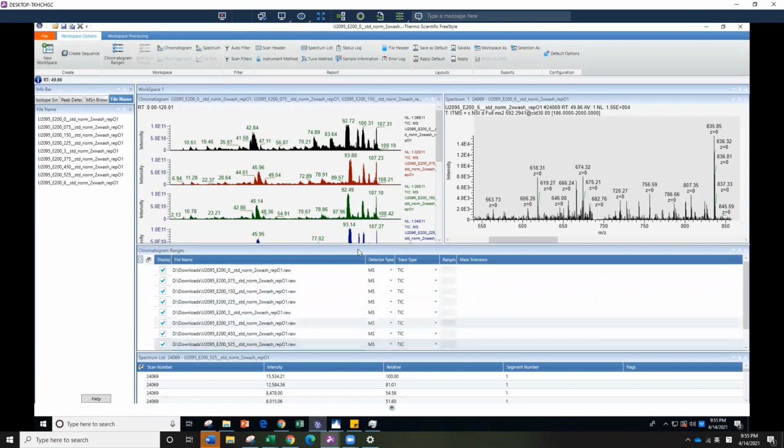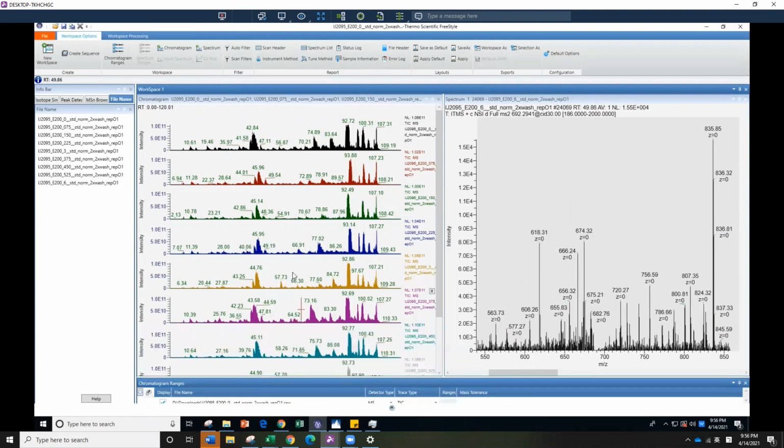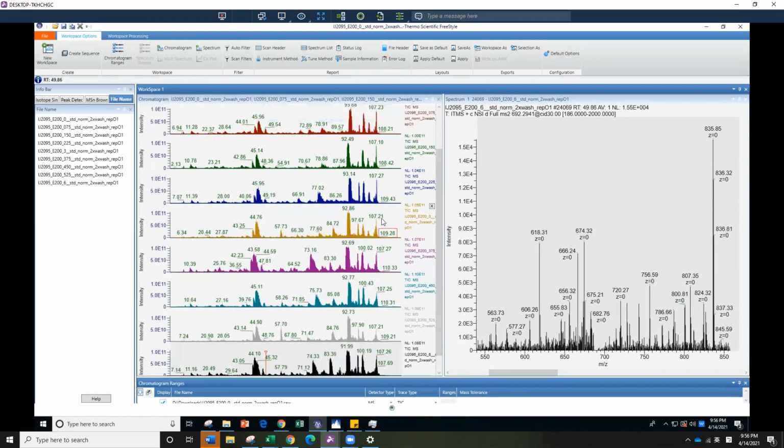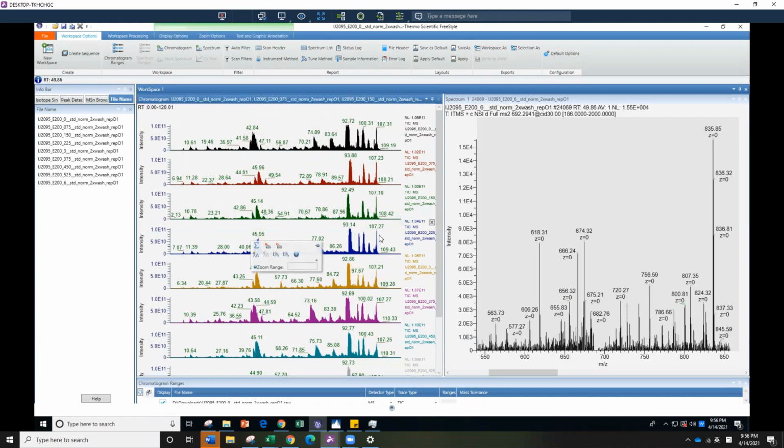So all my files are up. I'm going to make it smaller here, and I don't really need the spectrum list. So here are all the 9 files. You're probably not going to see it really clearly, so what you're looking for is any major retention time shift on features that stand out. Between different samples, you can see they have similar features: starting low, with some 3 peaks in the middle, then smaller peaks here, and at the end a huge peak when it's really hydrophobic. So that is the same feature. It is good for this set of samples.